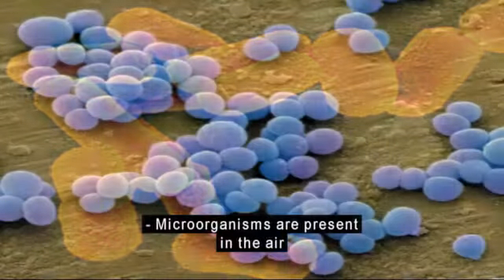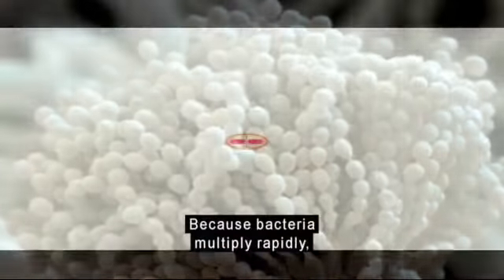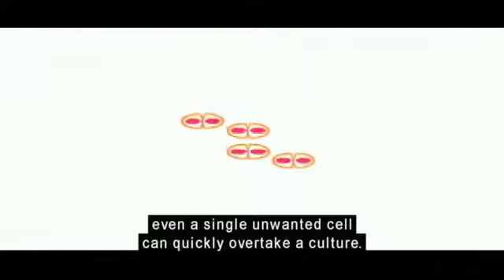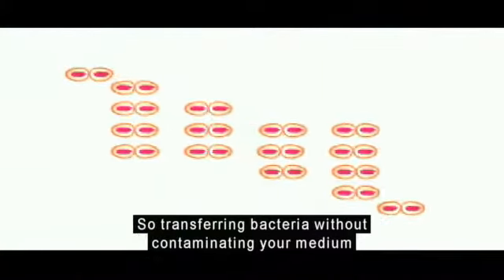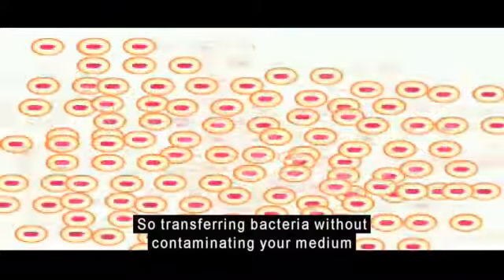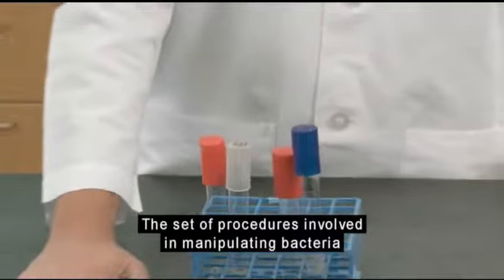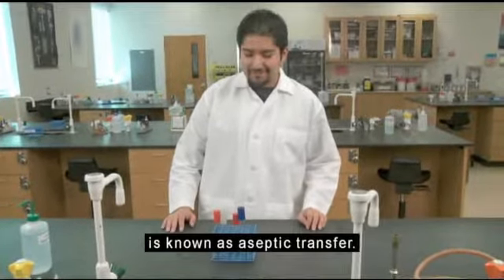Microorganisms are present in the air and on surfaces within the lab environment. Because bacteria multiply rapidly, even a single unwanted cell can quickly overtake a culture. So transferring bacteria without contaminating your medium is a challenge. The set of procedures involved in manipulating bacteria without introducing contaminants is known as aseptic transfer.